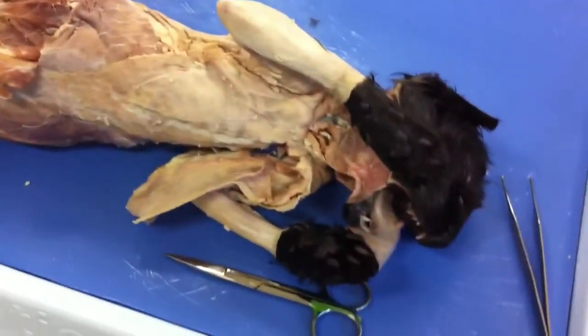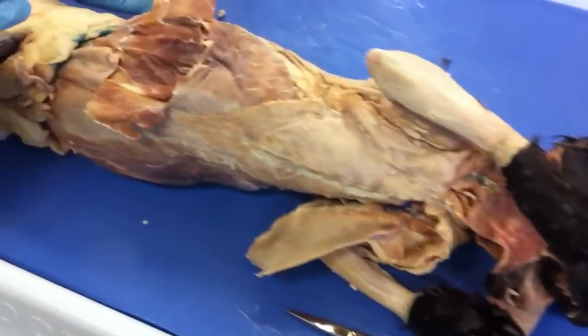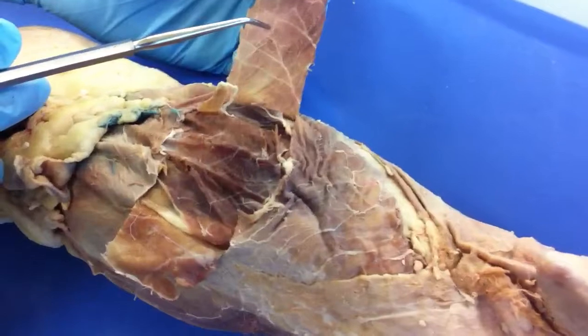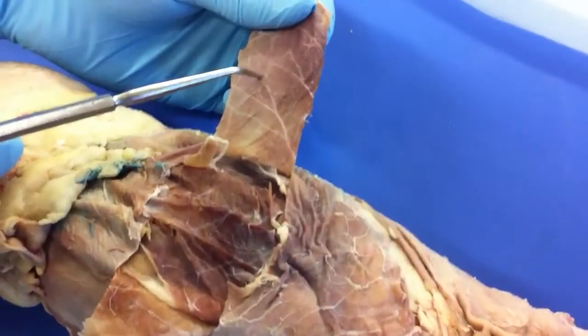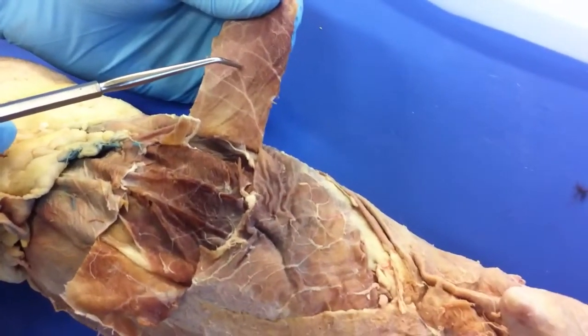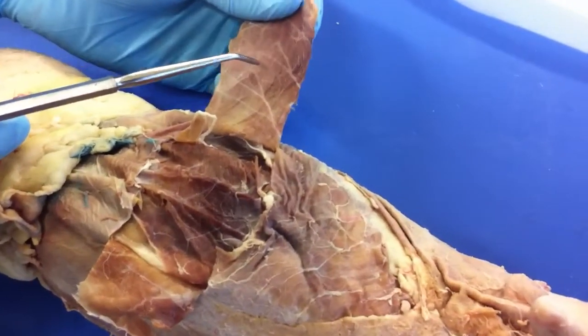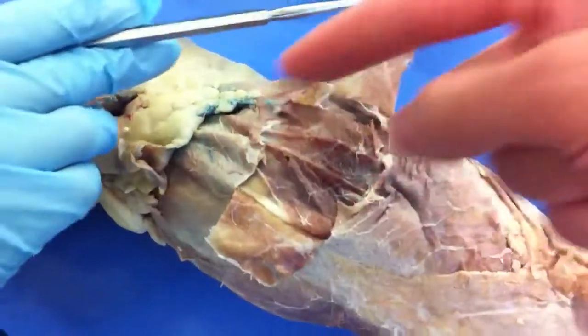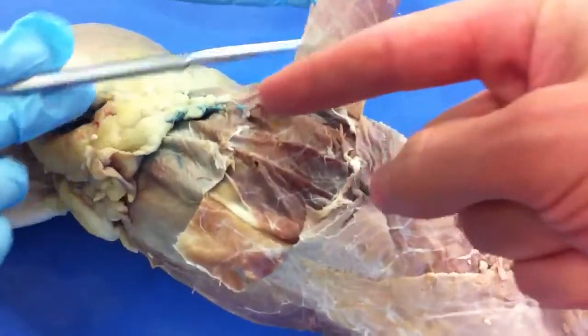Here is our cat. We're going to start with the abdominal muscles. The very top layer is the external oblique, which kind of points down towards the pelvis.